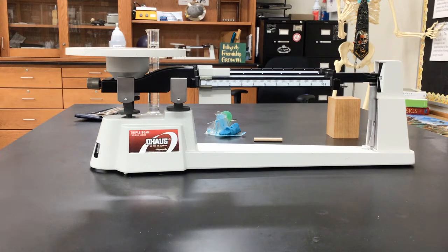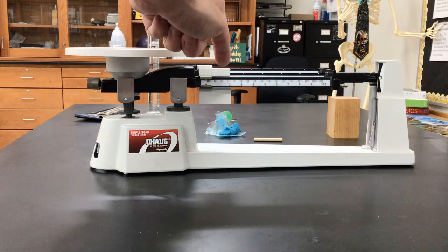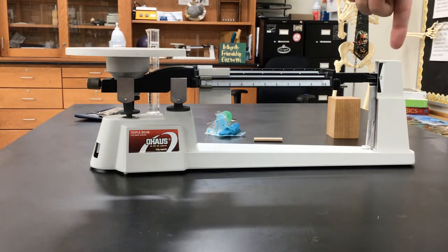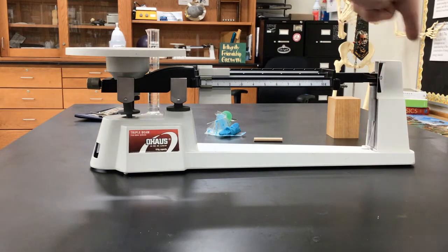That's the typical measurement that we use, okay? And then if you're using your triple beam balance, which is what we typically like for you to use in chemistry class, it's good at building up good thinking skills and good lab techniques. It's a good manipulative. So you can see that there's a scale, and there are three different scales, but what you typically do is the same. This tray right here, you put your object on it, and you see right here where the zero mark is. You can see that line that's balanced with it.